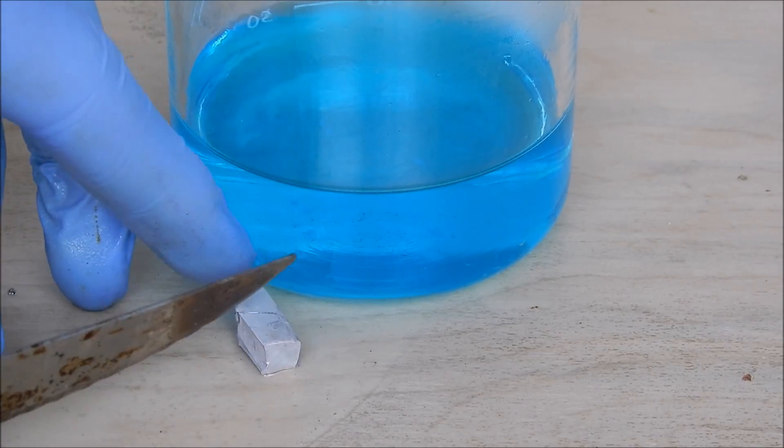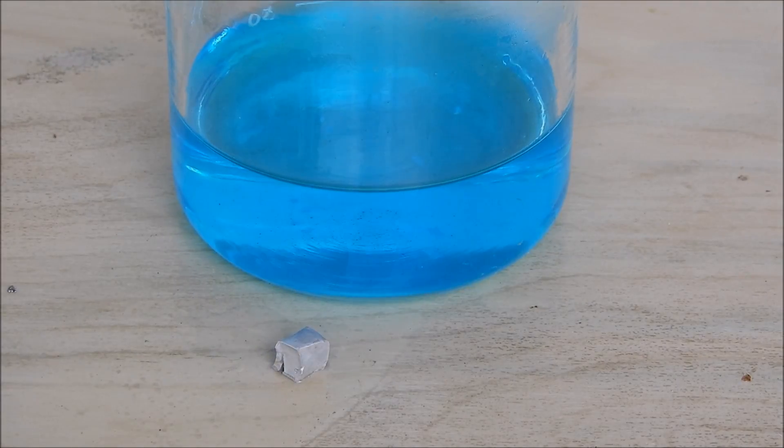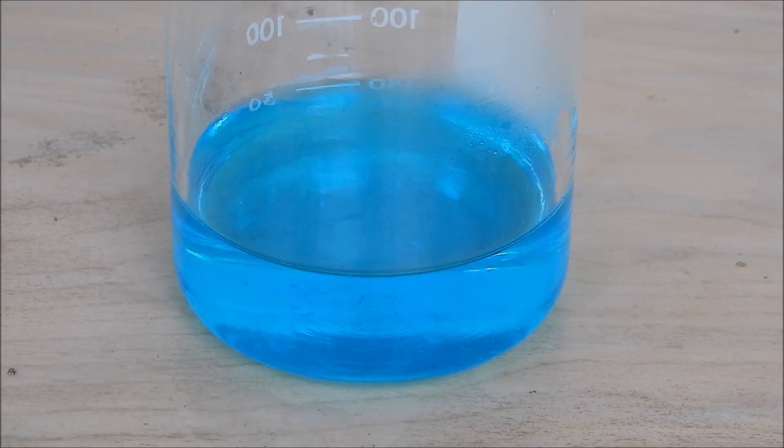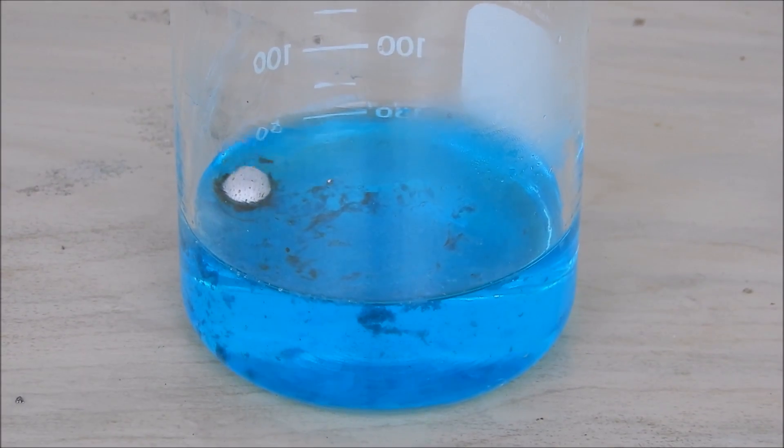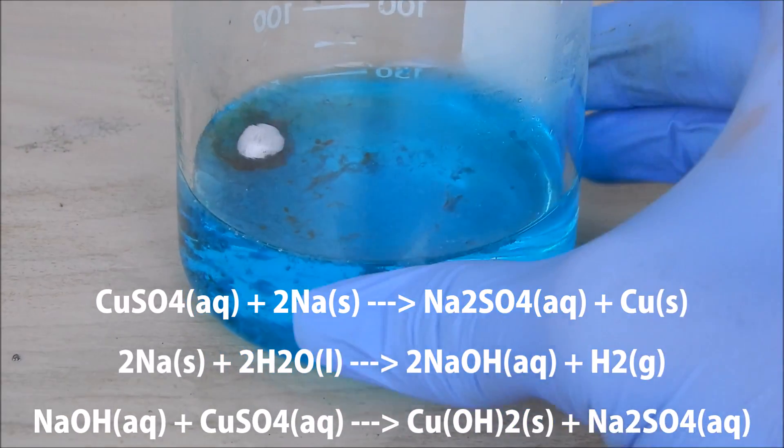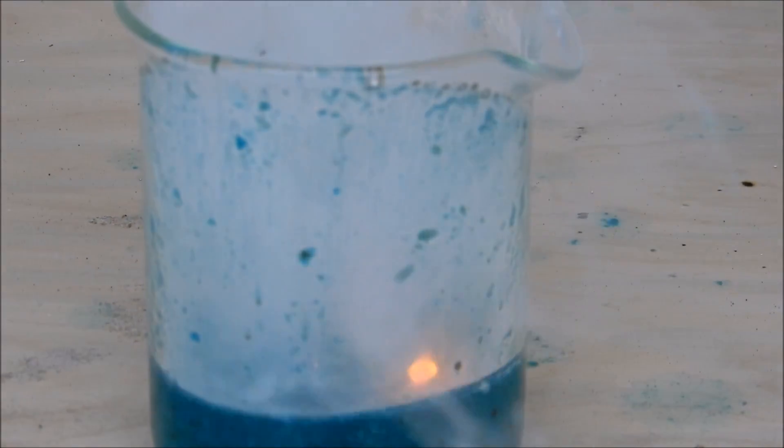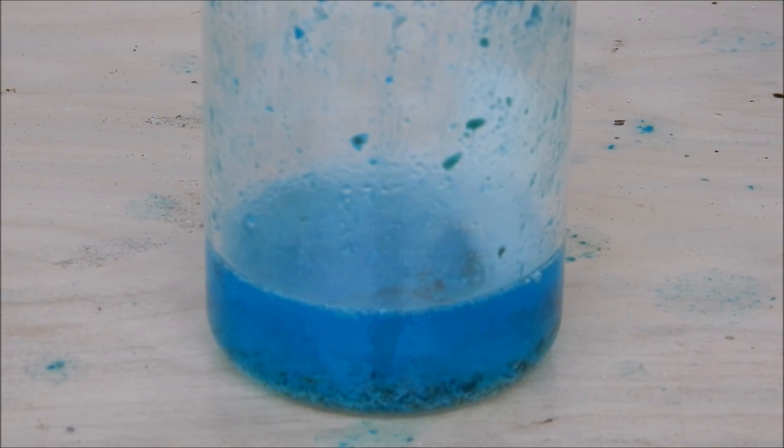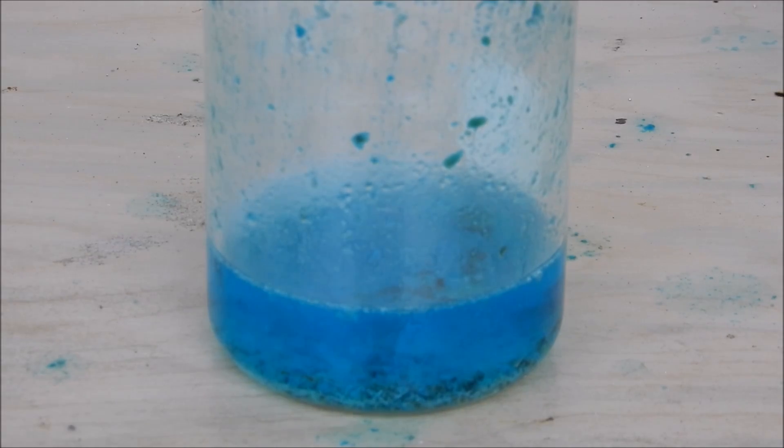Okay, let's see if we make some copper metal. Three, two, one—whoa! Looks like we got a black precipitate and I think it's working. Oh nice! Okay, so that was a lovely reaction. As you can tell from unorthodox reduction reactions like this one, you never really can tell what happens but you will know that it will be exciting.